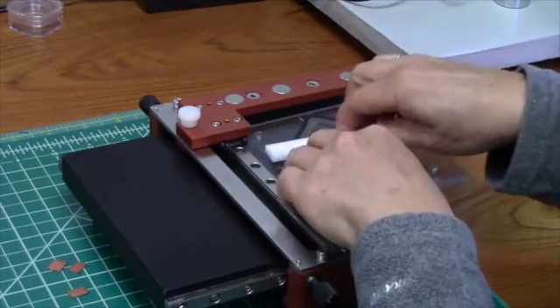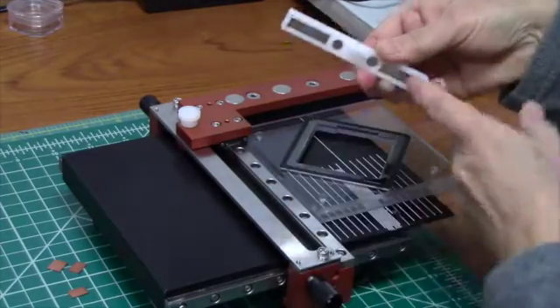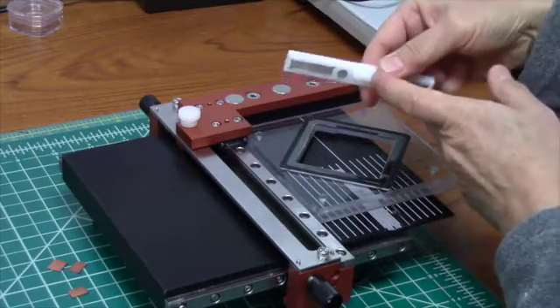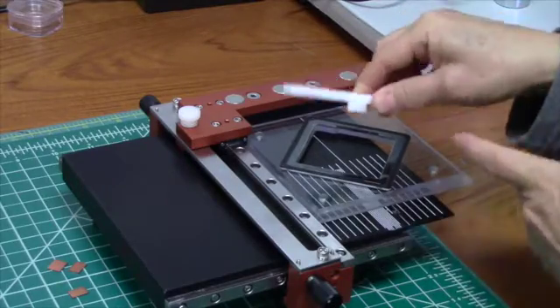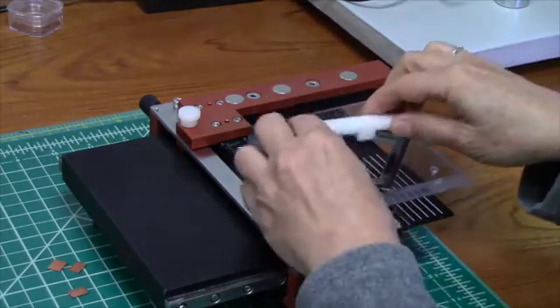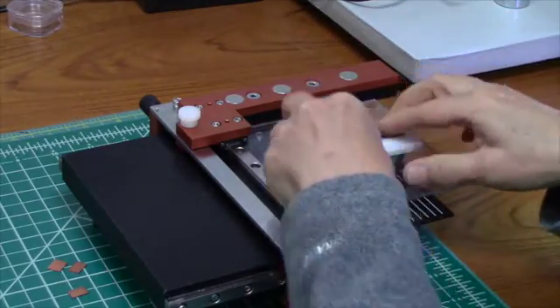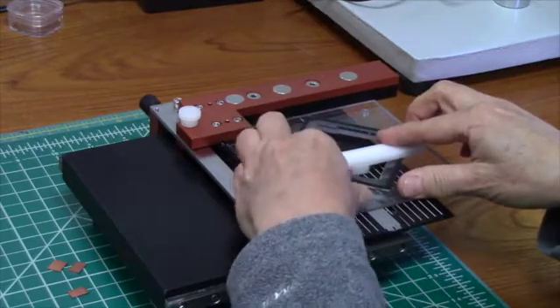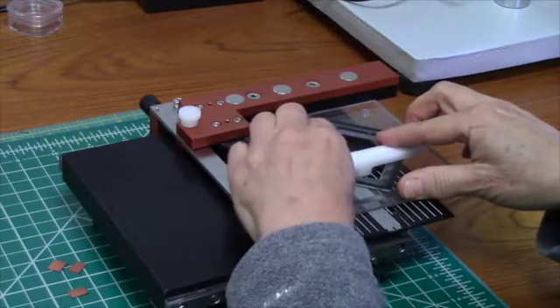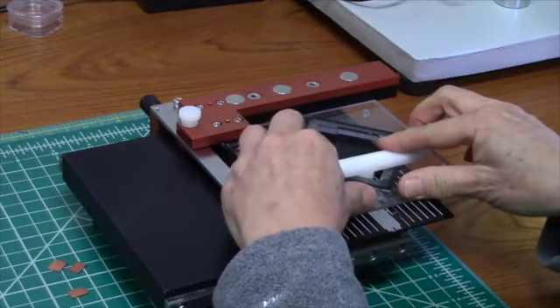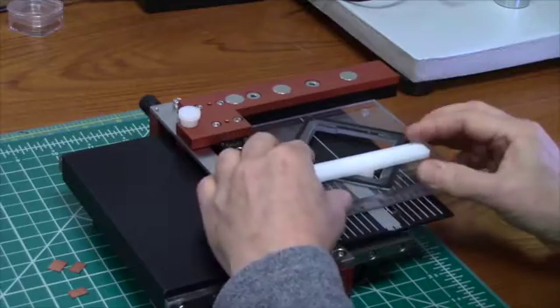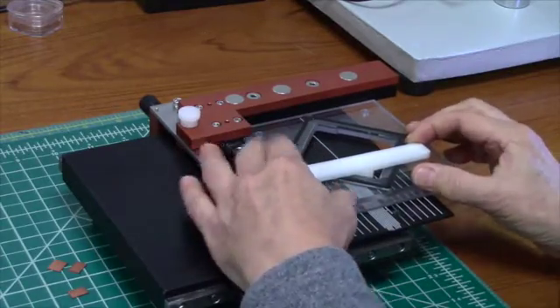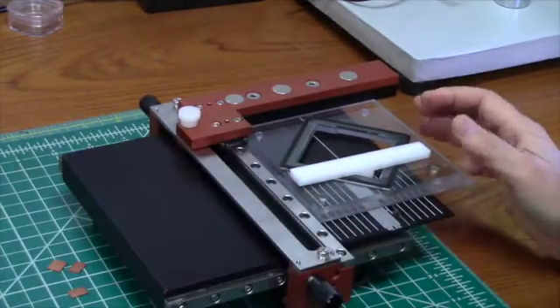There is a V at the bottom of the hold down to hold a corner of the sample. I'm going to take that V and slide it up over the corner of the sample to hold it in place.